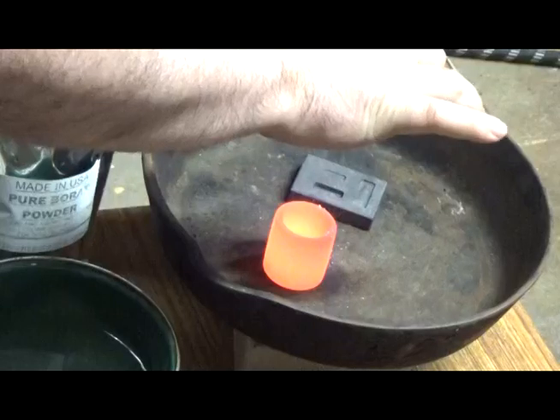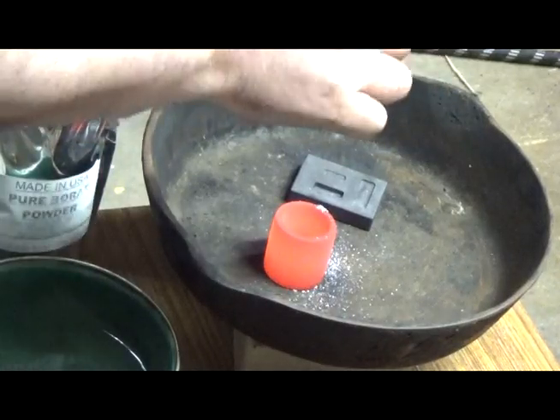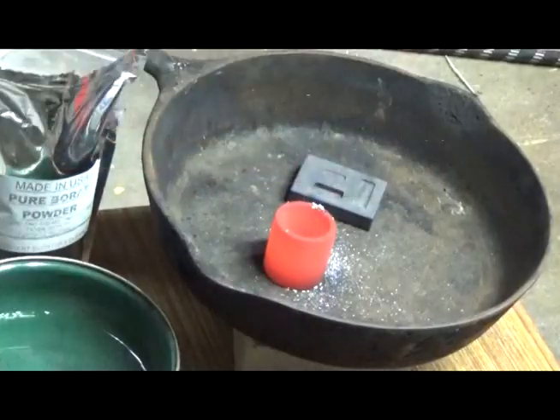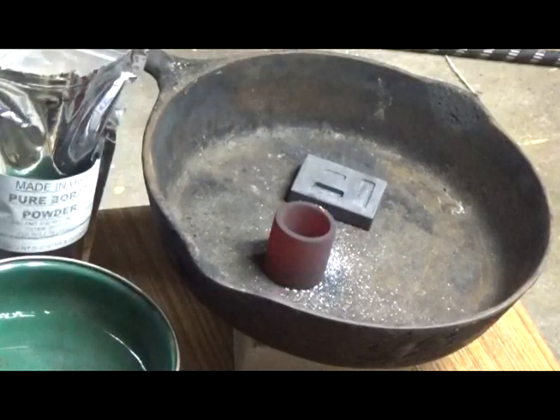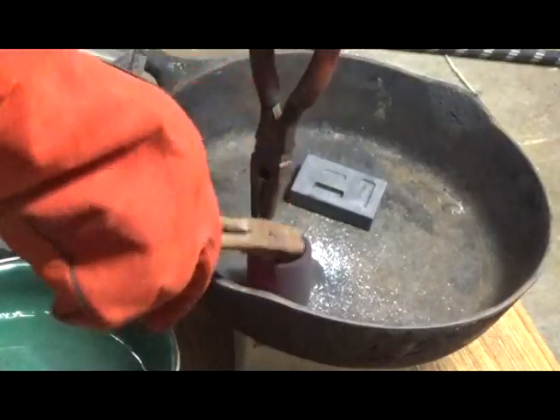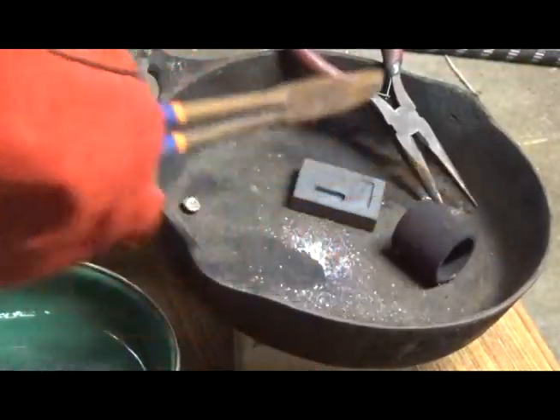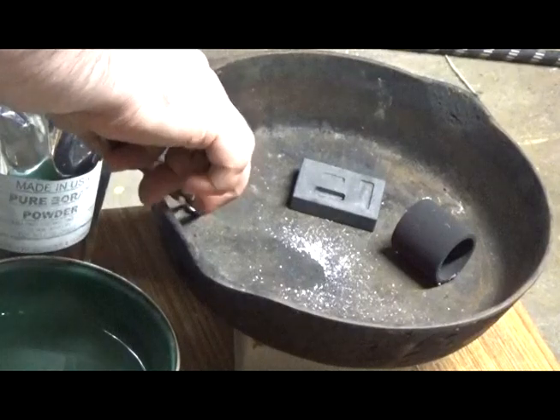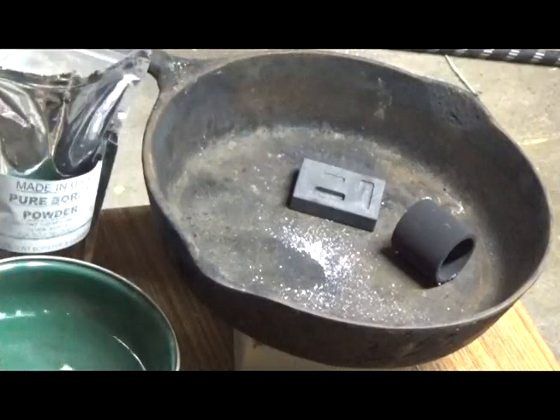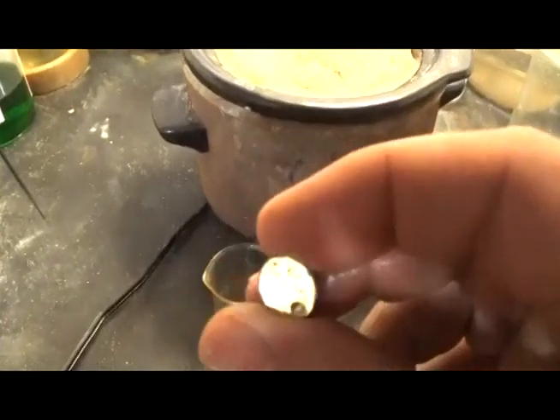Stick to the bottom of that. Get that all together there. It's going to stick to the bottom of the crucible, of course. Pull it all together. Furnace gloves off. All right, we got some flux on it, but that can't be helped. Nice little button. Very nice. That is a nice little button of gold.